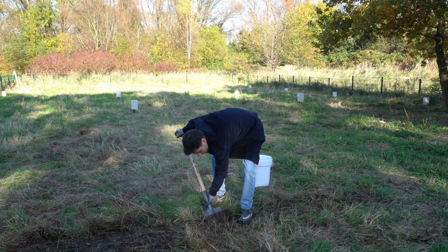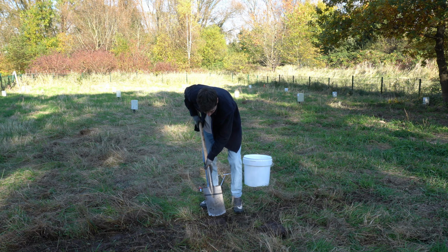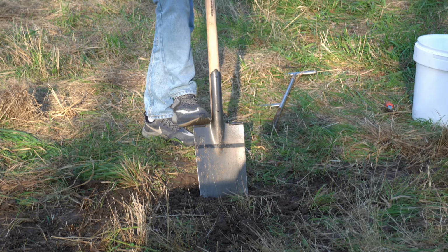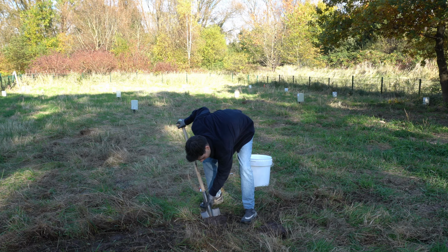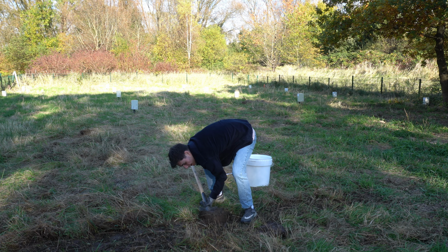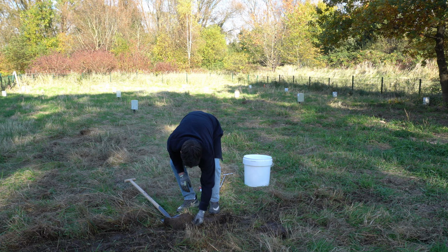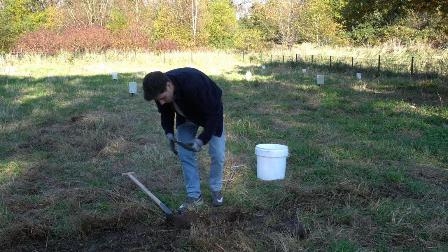And after we removed this first part of the soil, what we can do now is we just go to the side and we want a slice of about 3 centimeters. So we push in, and what we will get now is hopefully a very nice and even part of this soil. And if we get this out and we have this chunk, of course, you can see I have much more than 3 centimeters here. So you then use a trowel and you want an even sample.